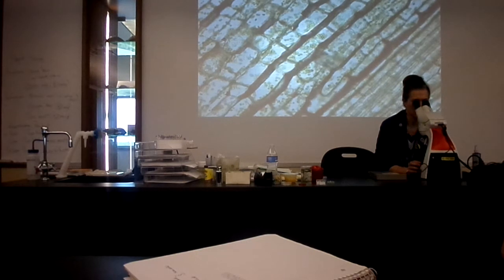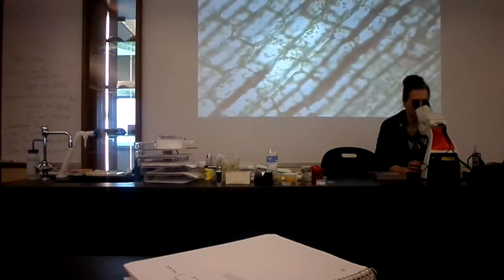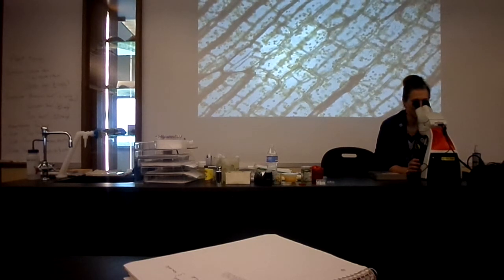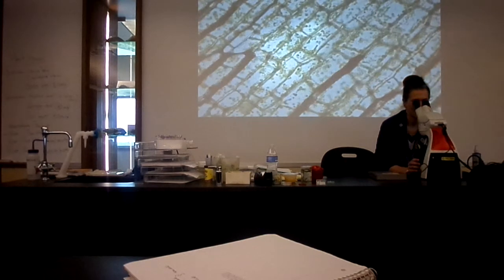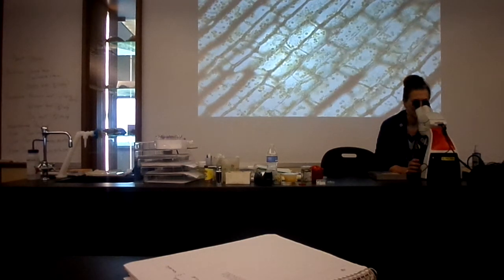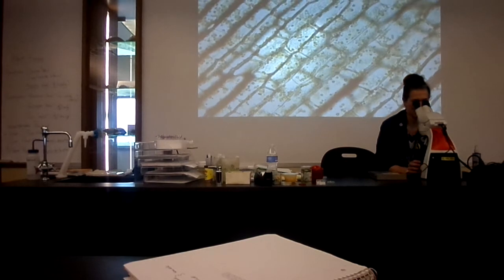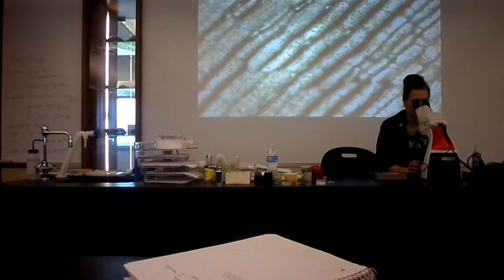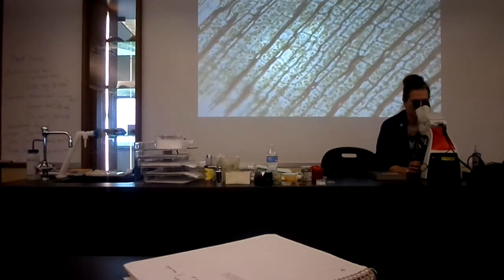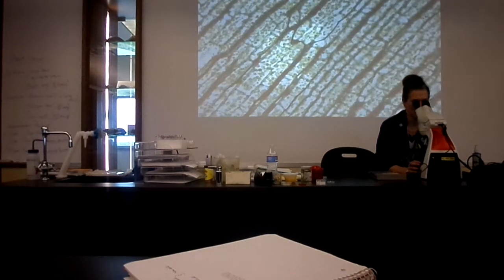And if you get those nice little young leaves at the tip, you'll see a little bit more of it. It's really, really good right there. Yeah, right here you can see it really well. It's really cool. Is it moving on y'all's? Oh, there's a transparent thing moving around. There's probably some little critters in there too. We had the extra bonus of seeing little critters swimming around in there today too, so you might see some of those little guys as well.